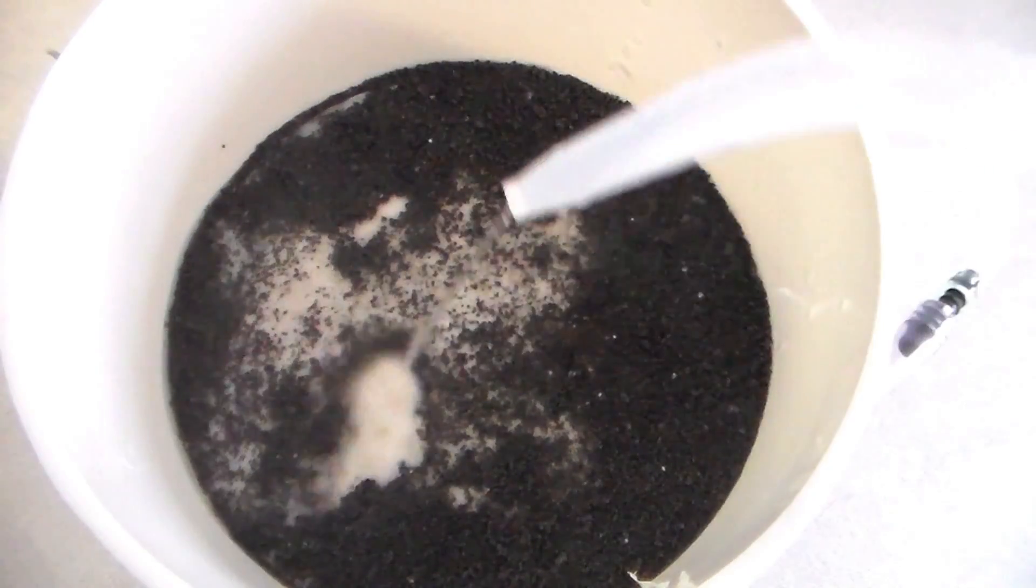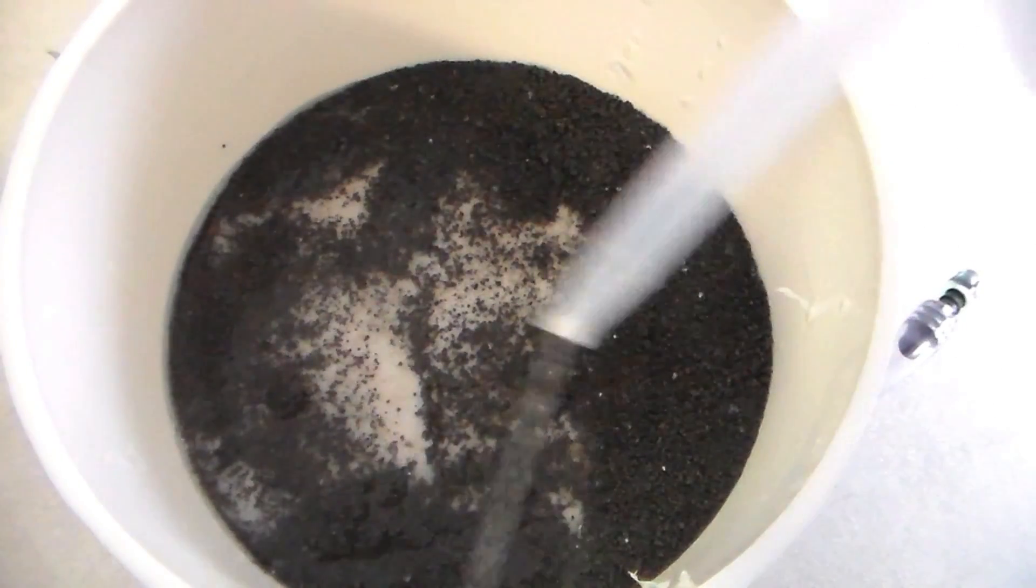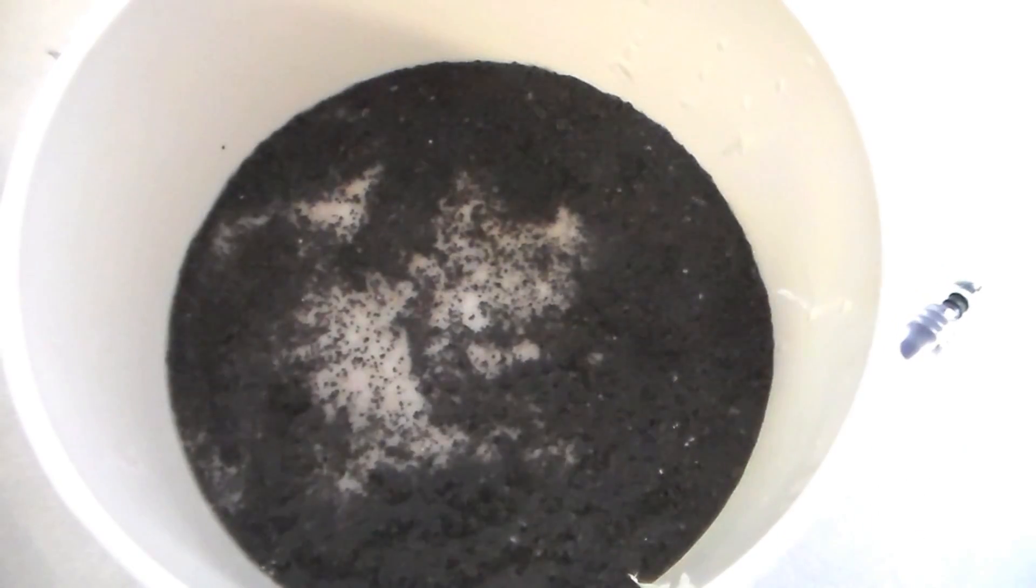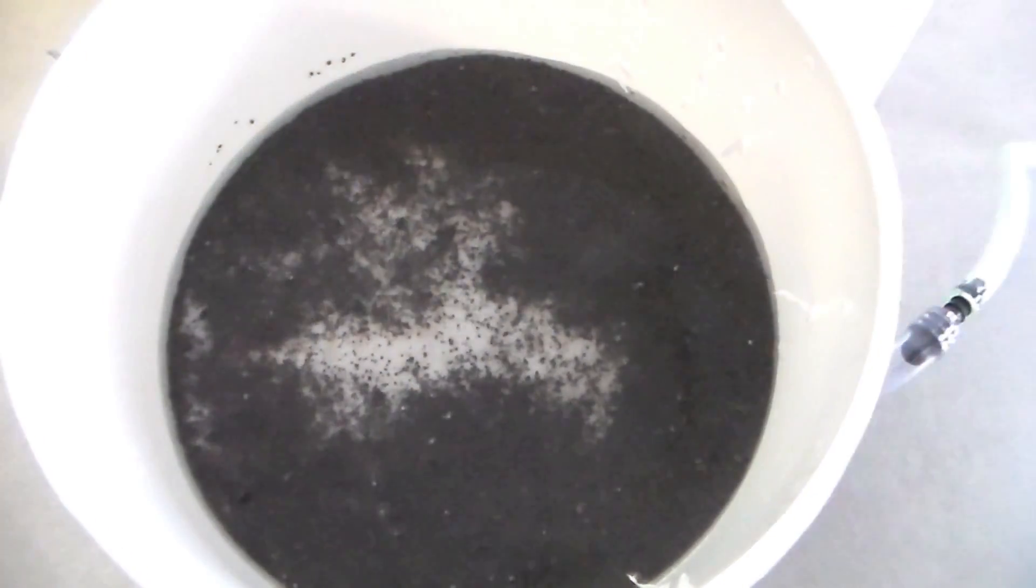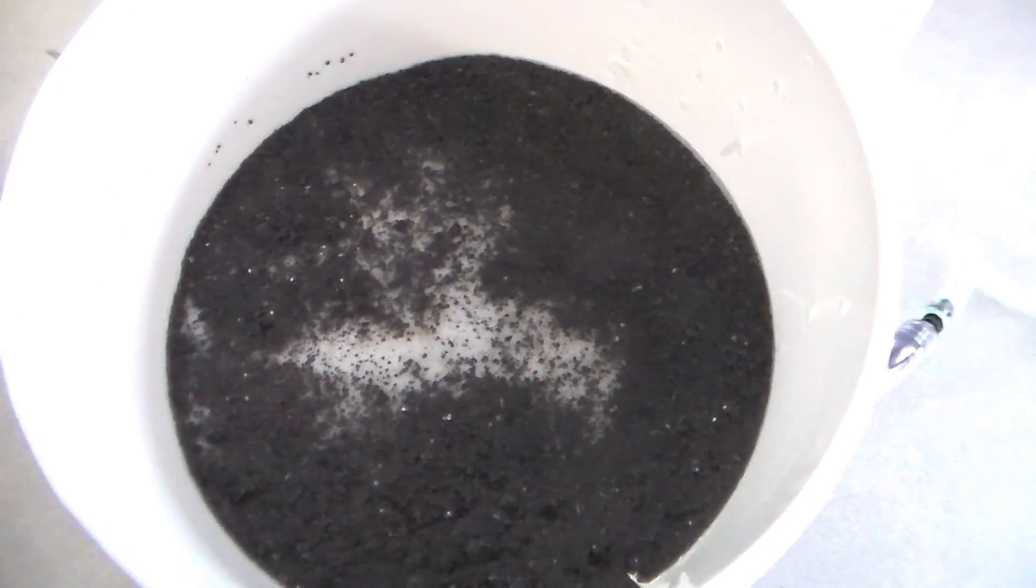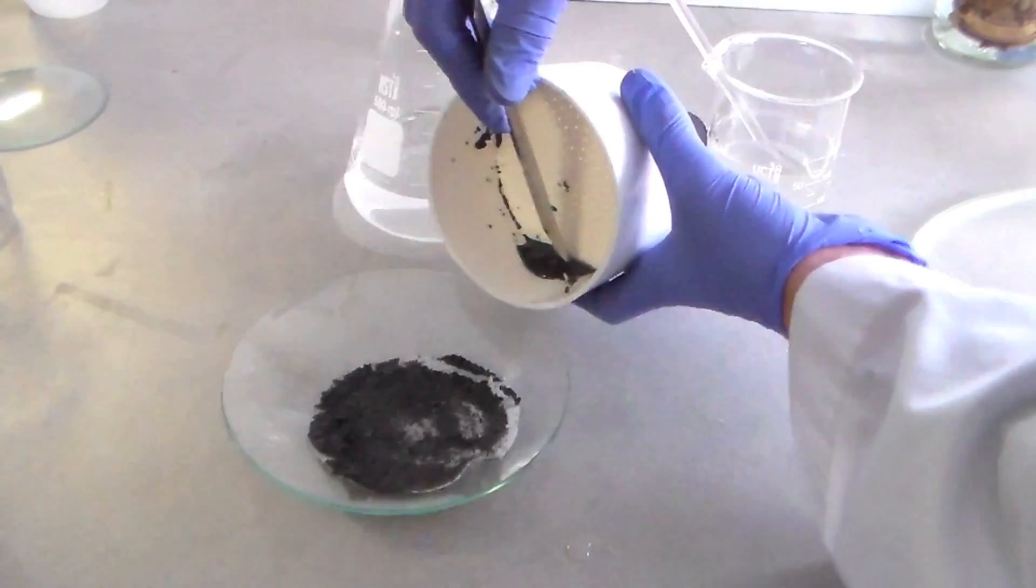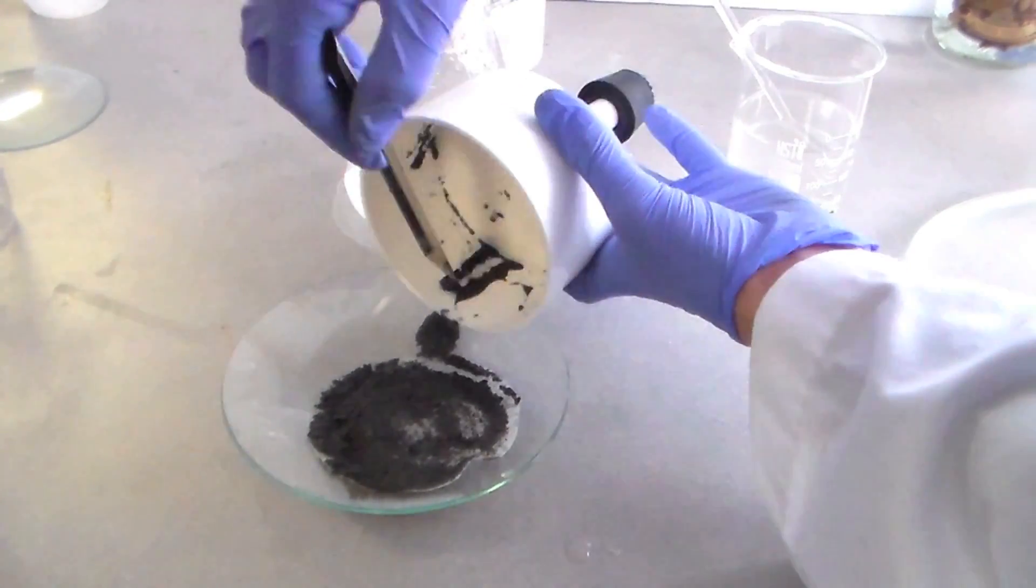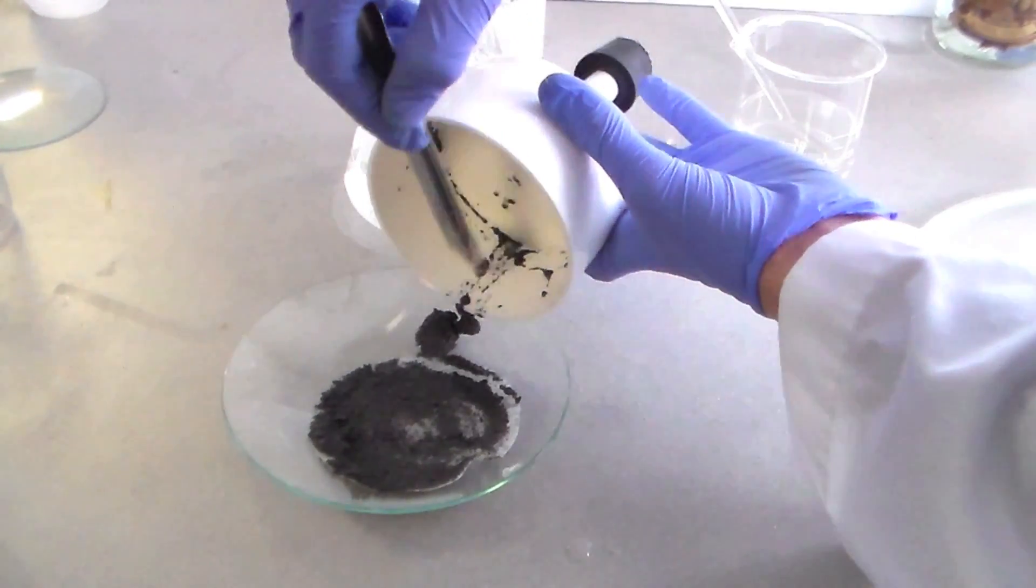I then washed the solids several times with distilled water. I only show one washing here, but in total I performed three washes. I then transferred the filter paper and remaining wet solids onto a watch glass to dry overnight.